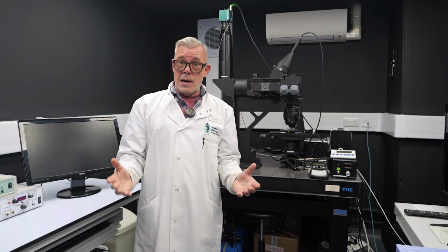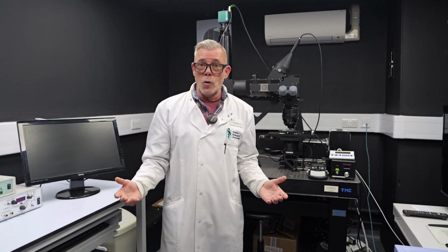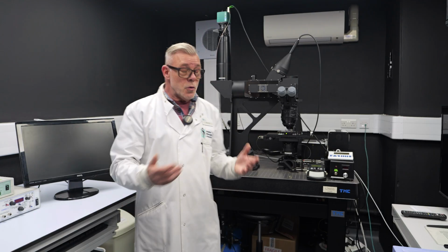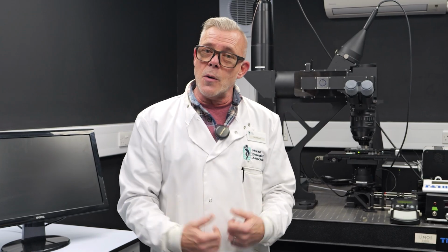And this is now opening up a lot of new areas in research fields, both internally here at the MBA, as well as with our many collaborators who work in marine laboratories around the world who don't have a Mesolens microscope in their laboratory. So it's enabling a lot of future collaborative work in the field of marine research.